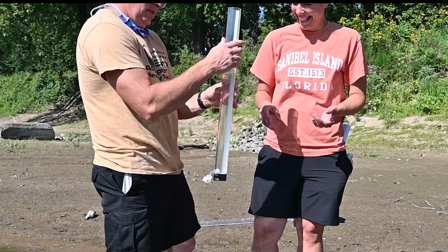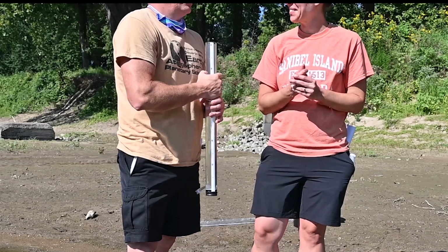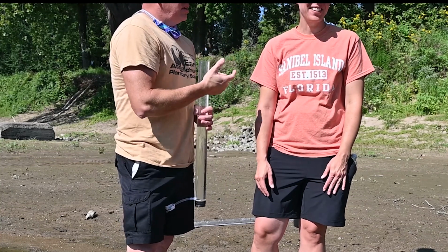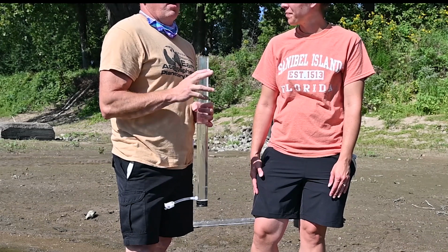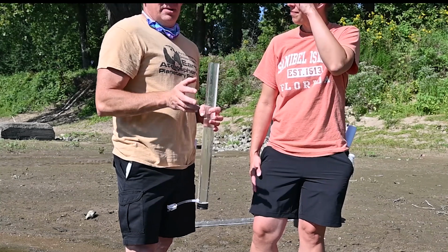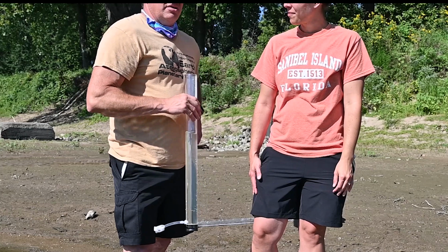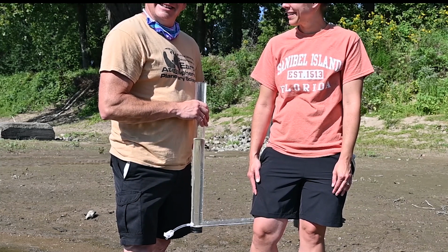What is this measuring? Is that 37 elephants? No, this is going to be 37 centimeters. Oh, centimeters. I knew there was a unit. Now, we're not going to just write that down. We're going to retest it 3 times and then do the average of those 3, unless one of them was way off. If there's an outlier, we would just get rid of that data point because we did something wrong. But then we'll take the average. So we're going to do this a couple more times and we'll be right back.